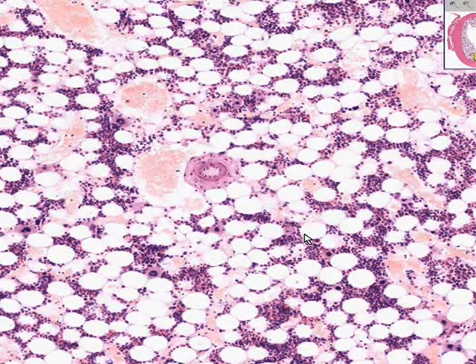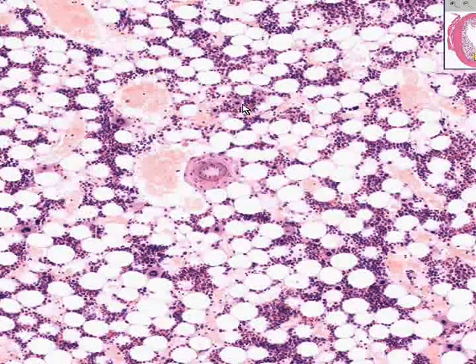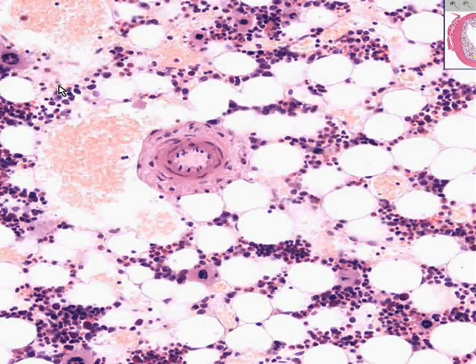And the cells make red cells, white cells, and platelets. And the precursors of platelets are these huge cells, which we see here, and here, and here, and here, called megakaryocytes, and the rest of these generally circular cells, which we're not going to be able to really identify with a great amount of confidence, are going to be making your red cells and white cells, or myelopoiesis and erythropoiesis.